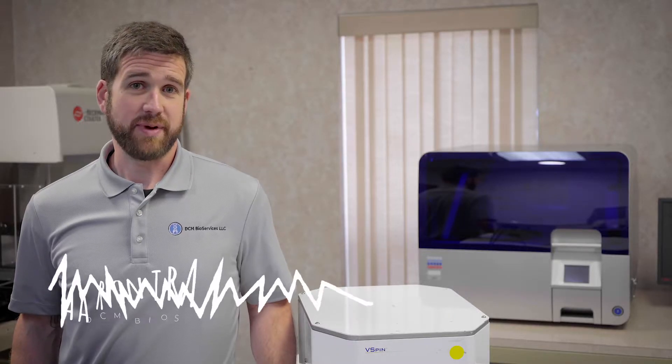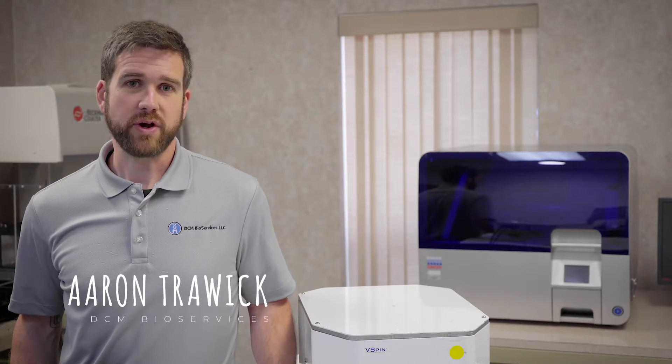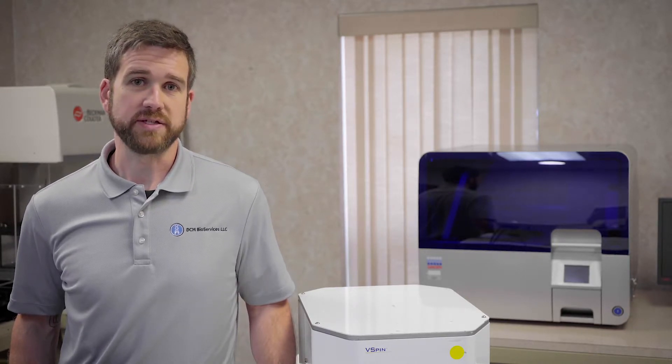Hello, this is Aaron from DCMBio Services. Today we'll be walking you through teaching the buckets on your Agilent V-spin microplate centrifuge.